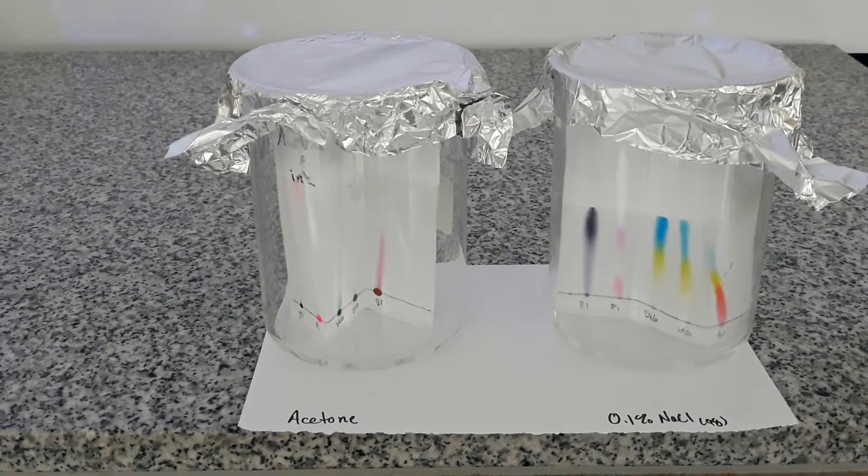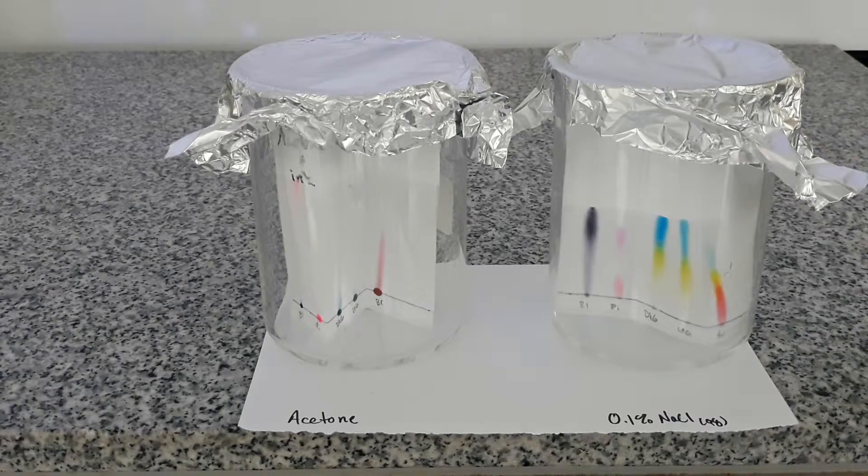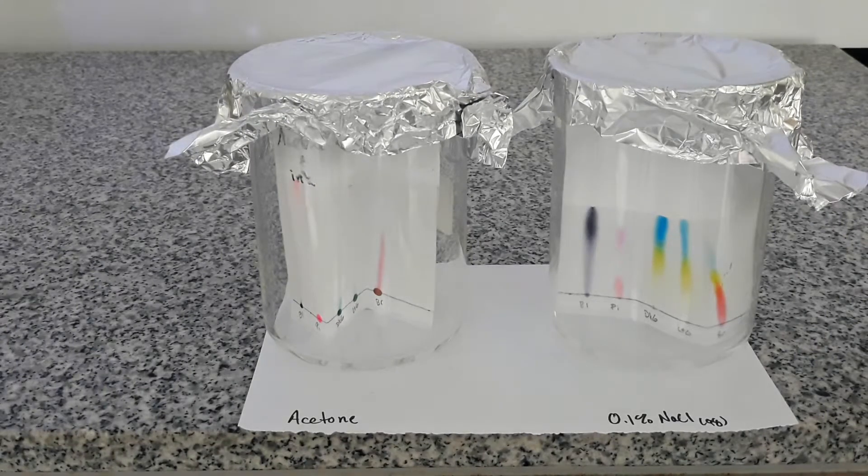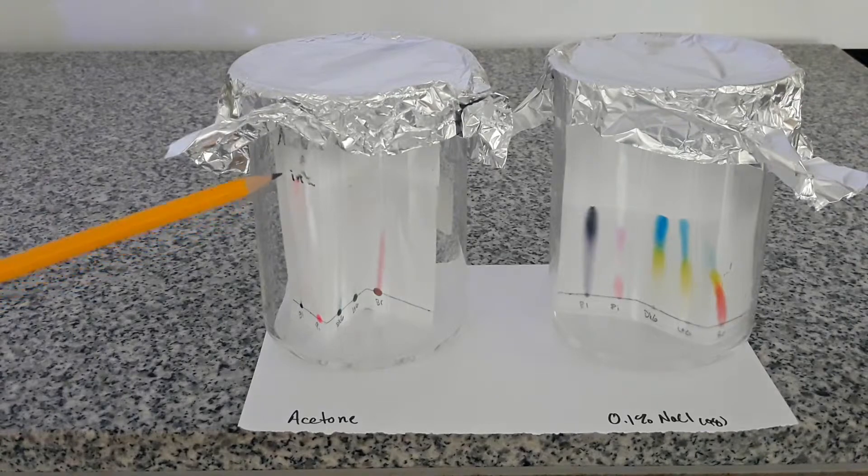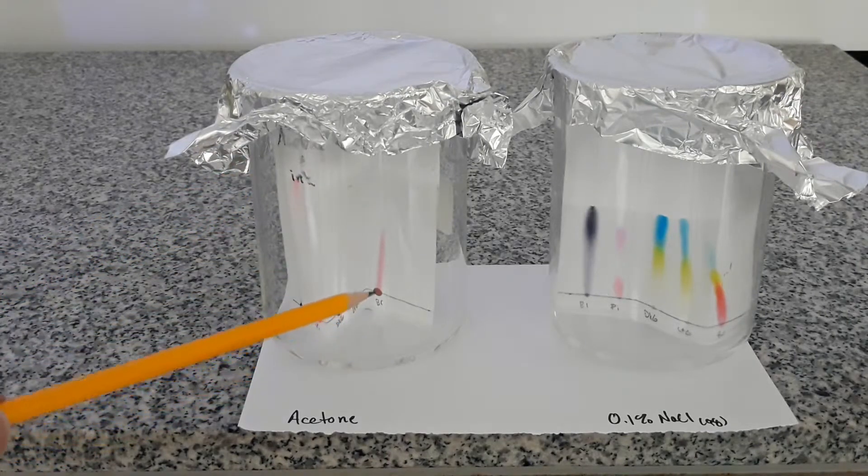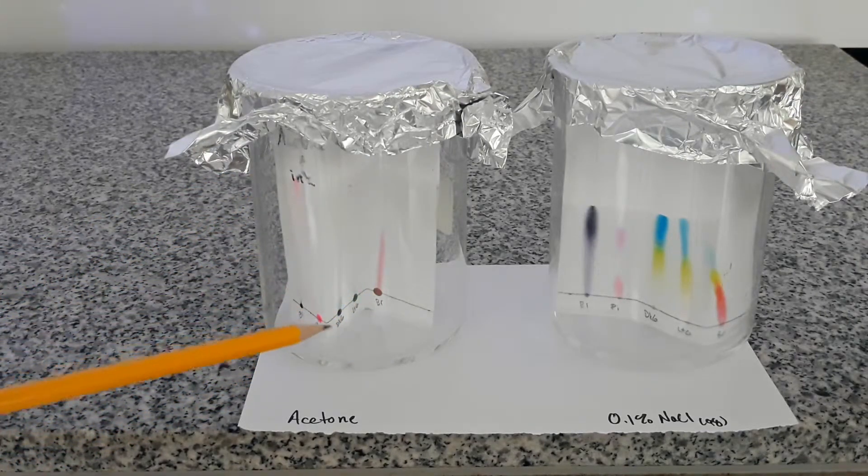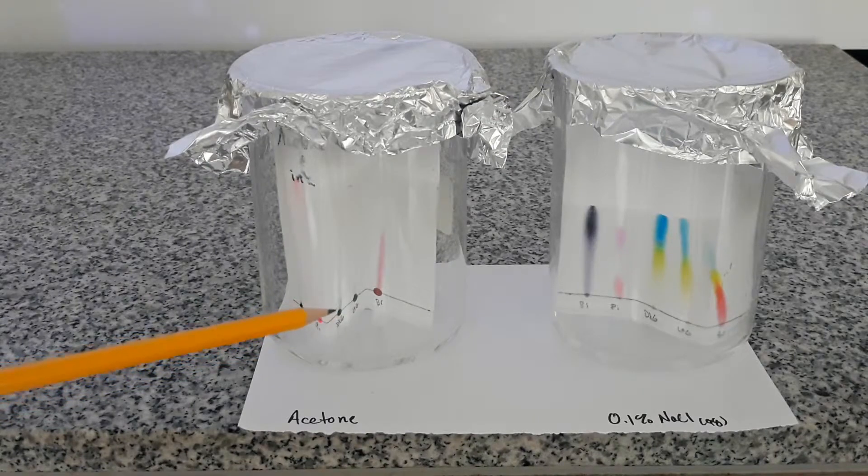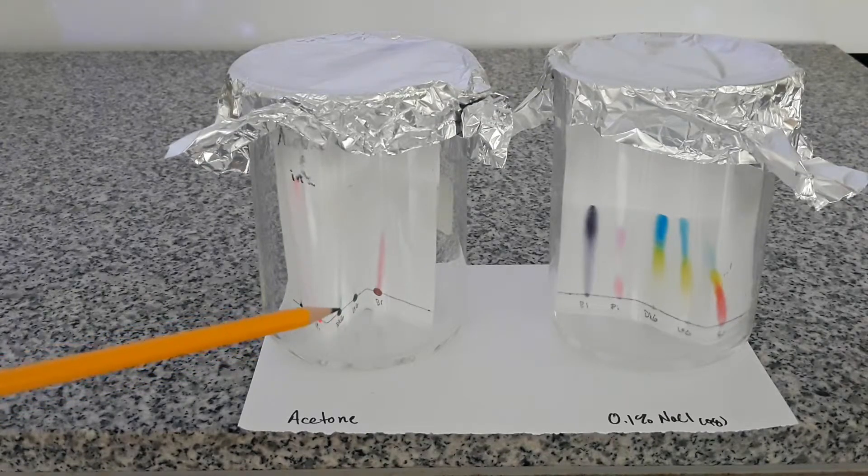I'm going to stop the runs here. It's a little early in the process. You can see the acetone solvent front isn't quite near the top and the sodium chloride solvent front is somewhere in the middle of the page. Just the constraints of my camera.